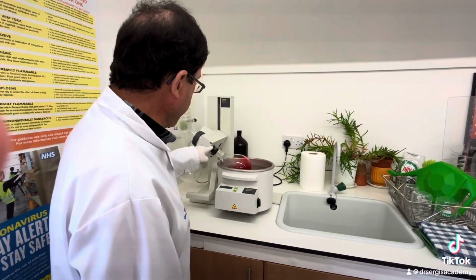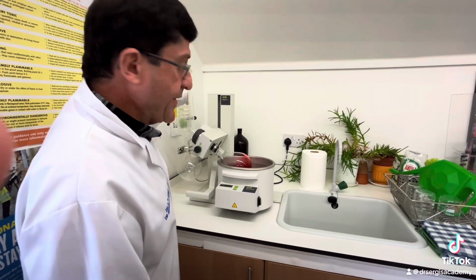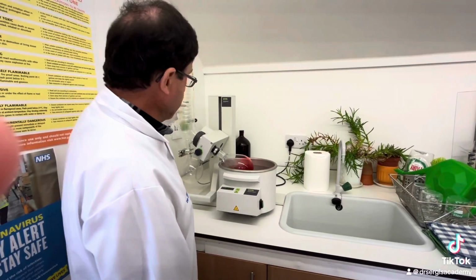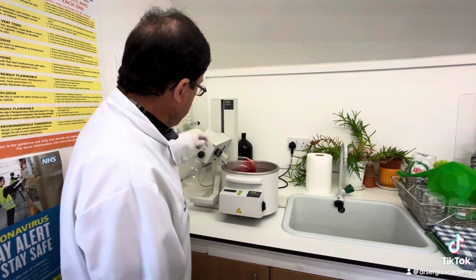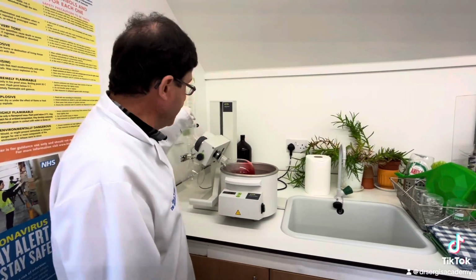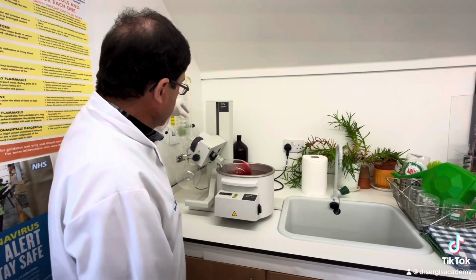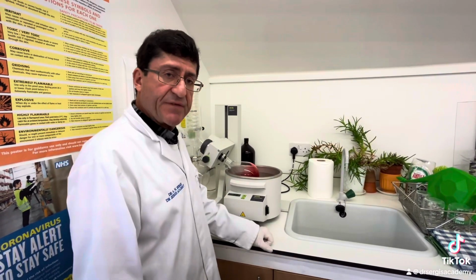And the gas goes up through this condenser, which is cooler than the vapor, because the condenser has a temperature well below 70 degrees, let's say 25 degrees, room temperature. So if it's water, it has a temperature of roughly 20 to 25 degrees, which is cooler than the vapor, which has a temperature above 70 degrees.